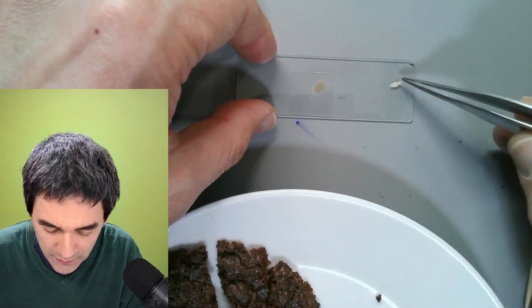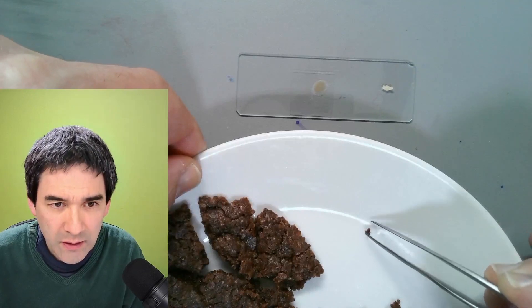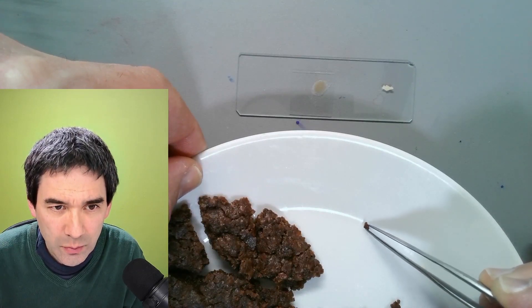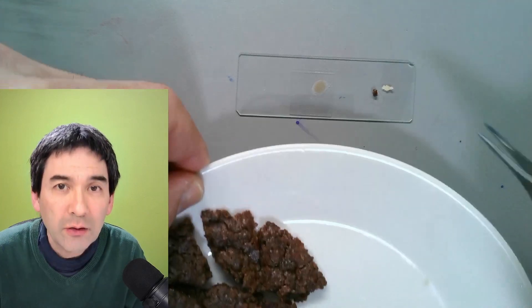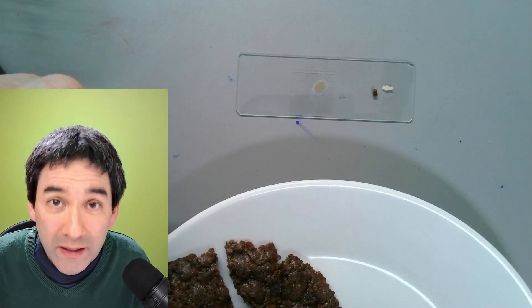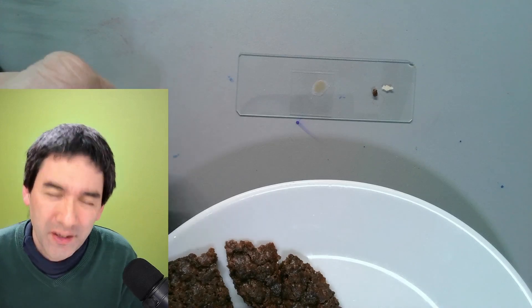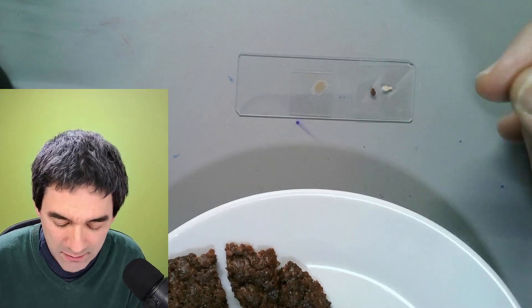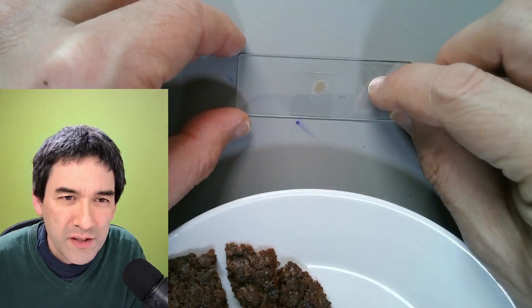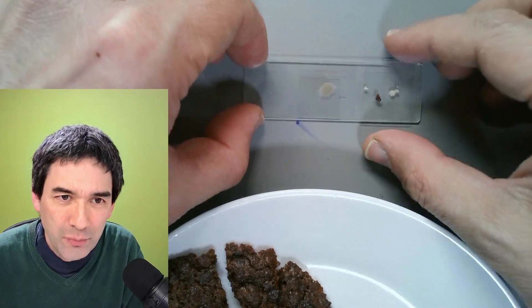So here, that's one of them. From down here I'll take the other one. What I'll do now is put the cover glass on top directly. Then I'm going to add the water afterwards under the microscope. Here is the cover glass. Maybe I'm going to press it down a little bit just to make it a tiny bit flatter. And it goes under the microscope now.